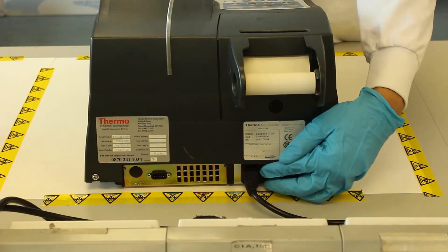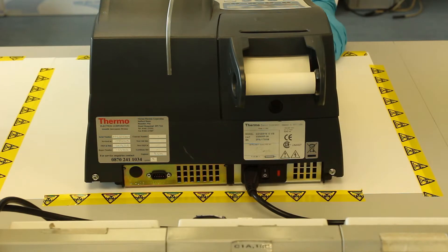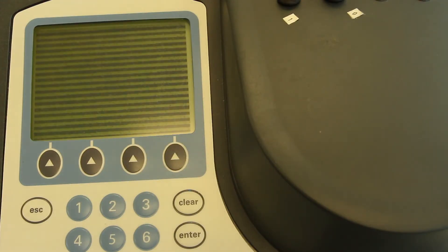Look for an on off switch and flick that to on. If the display is digital this should activate.